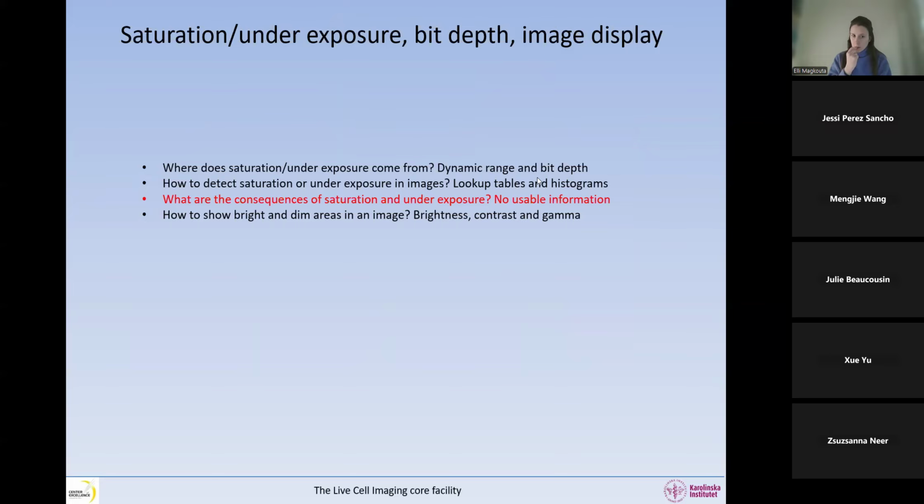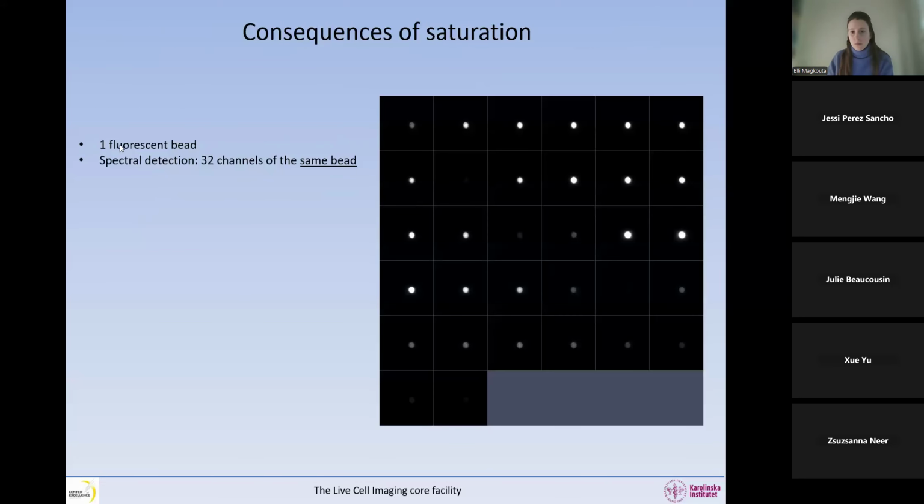So now that we spoke about the lookup tables and the histogram and how they can help us explore our sample and also figure out if our parameters are correct or not, what are the consequences of saturation and underexposure? Here we are imaging one fluorescent bead with a spectral detector. So we have 32 channels. Today, Gabby has a lecture about how to image multiple colors, so we're more about the spectral detection.